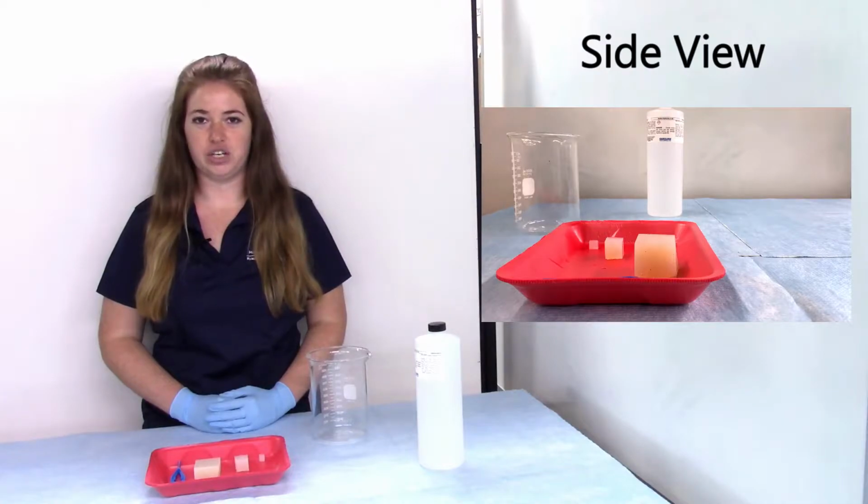As we discussed, substances can move in and out of cells through diffusion. Remember, diffusion is the movement of substances from an area of high concentration to an area of lower concentration. I've prepared 3 agar cubes so that we can watch diffusion happening.